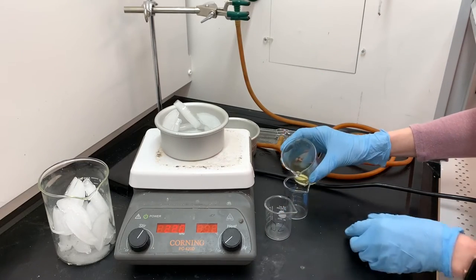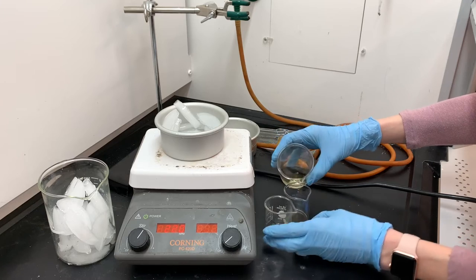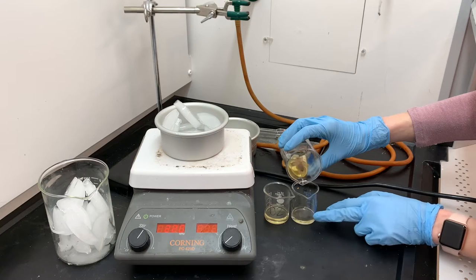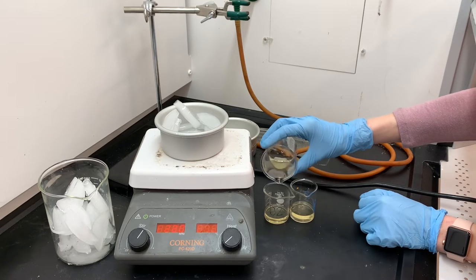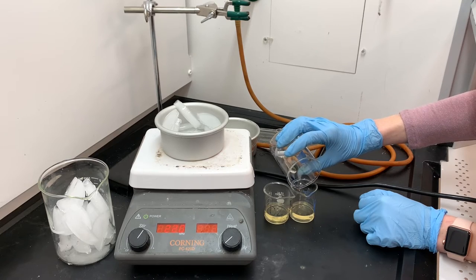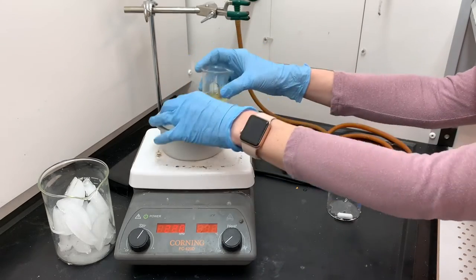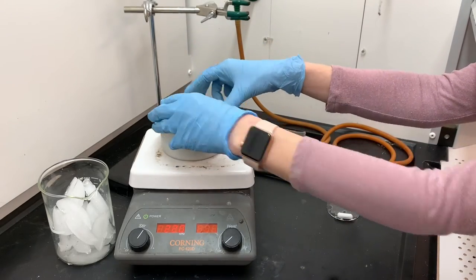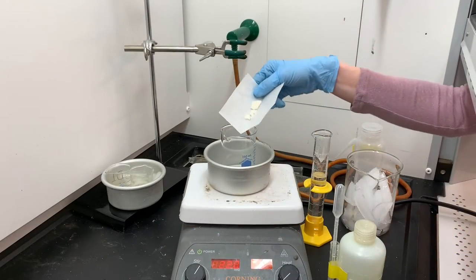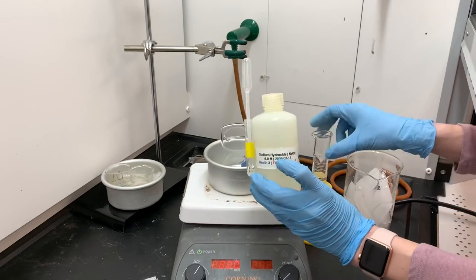From the introduction, I'm going to be synthesizing this azo dye in two different methods, so I'm dividing the diazo compound in half for each method. This isn't an exact division — I'm just eyeballing to get the same volume in each. I'm going to keep these solutions in the ice bath until I'm ready to use them so they stay fresh. Here is my resorcinol that I've already weighed out. This is what I'm using for the coupling component, and I'm going to dissolve it in some sodium hydroxide.